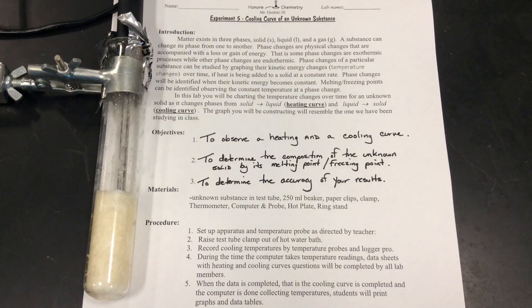Let's get to the lab and look as I do this lab for you in terms of the data. We're going to see a time lapse of this solid melting and then we'll look at the data after.